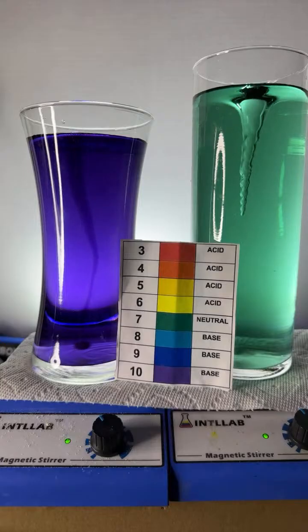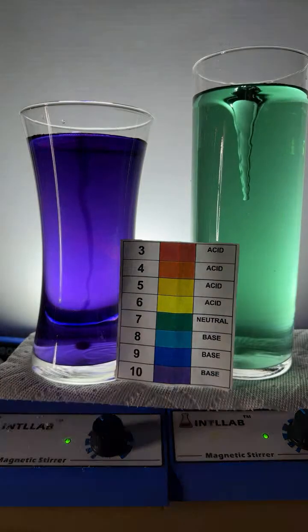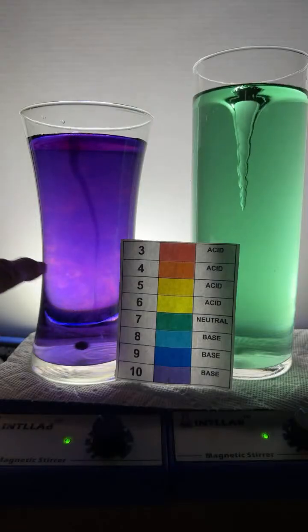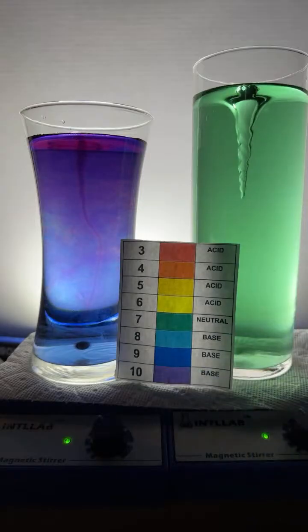Okay, here we go. We're going to add some acid over here to this flask on the left. So there goes a drop of acid. Let's watch what happens. I'm going to turn this around because I think the colors are more beautiful. You can see them a little better. Look at how the red color from the acid is going through. Now, the acid and base are reacting with each other. And when they sort of equalize, we'll see what pH they end up at.